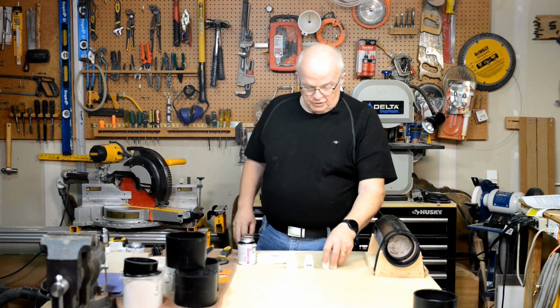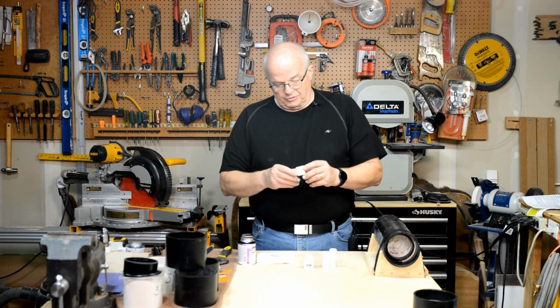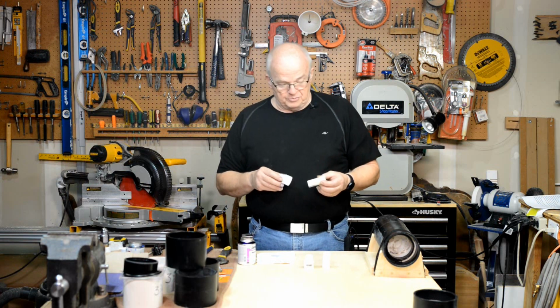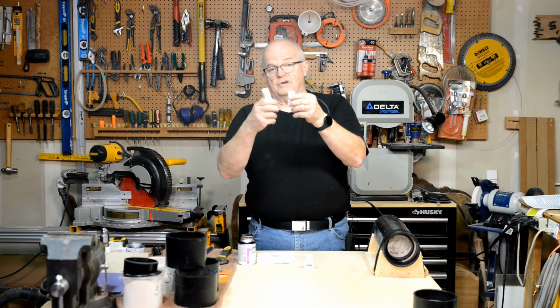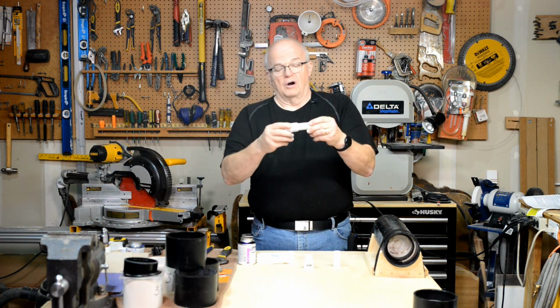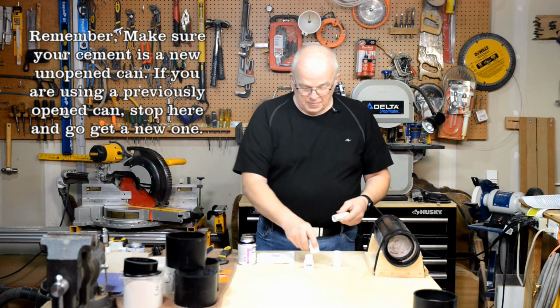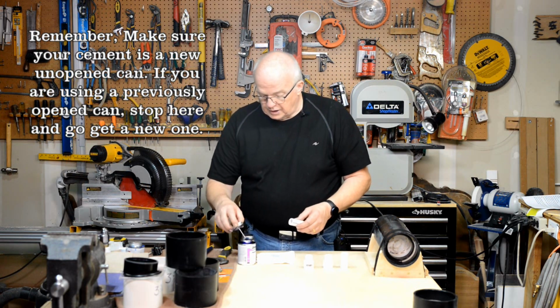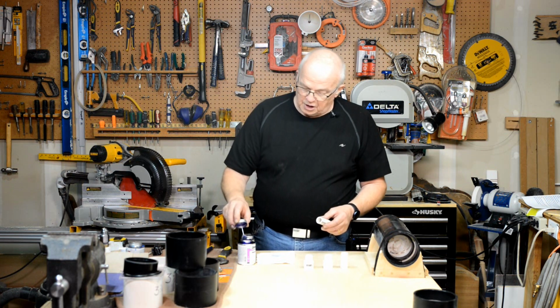The next thing you want to do is glue your PVC male pipe thread adapters to these 2 short pieces of 3/4 inch PVC pipe. Now, if you put the bevel around one end of each one, which you should have, you're going to want to cement these onto the end that doesn't have the bevel. In other words, you want the bevel to be free for later on. Now, let's apply some primer.